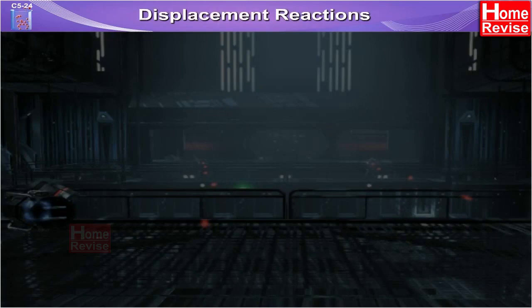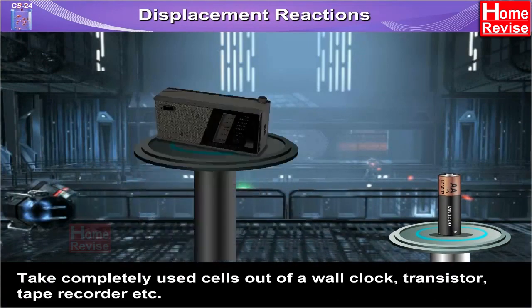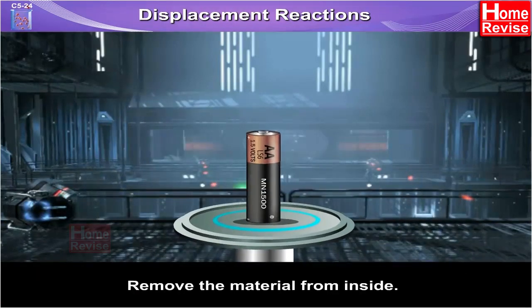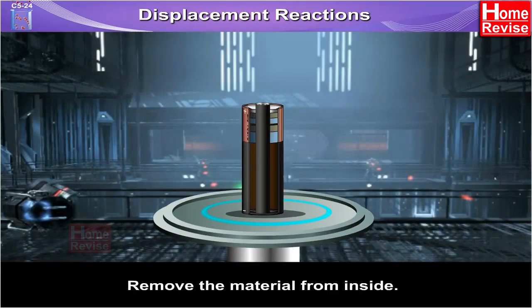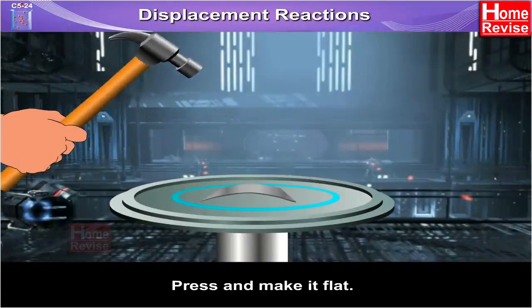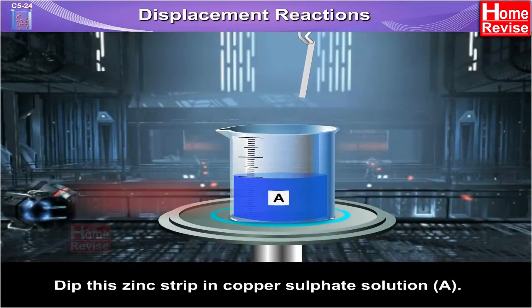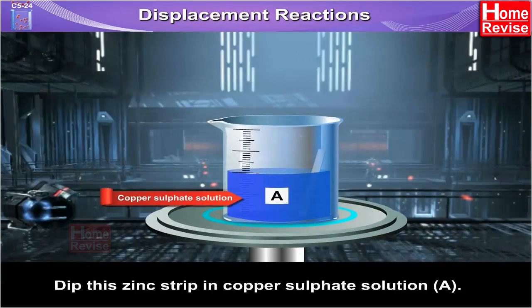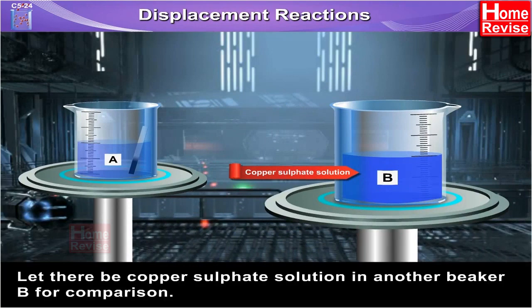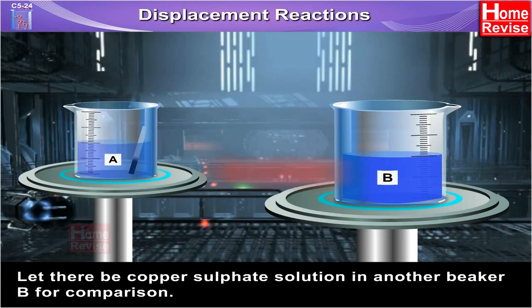Displacement reactions: take completely used cells out of a wall clock, transistor, tape recorder, etc. Remove the material from inside. You will get a can that is made of zinc. Press and make it flat. Dip this zinc strip in copper sulfate solution. Let there be copper sulfate solution in another beaker B for comparison.